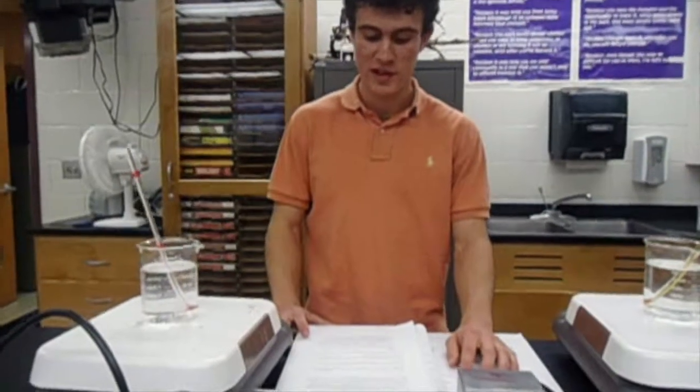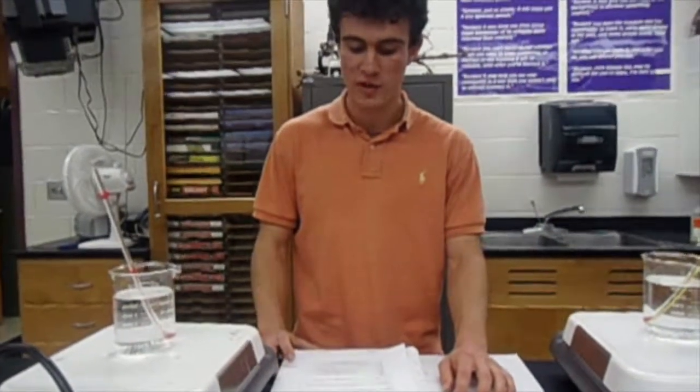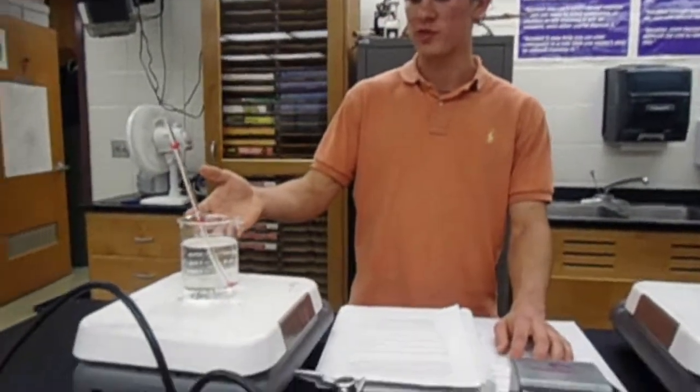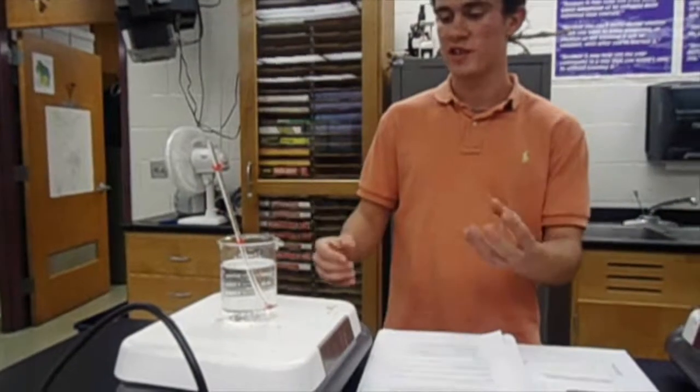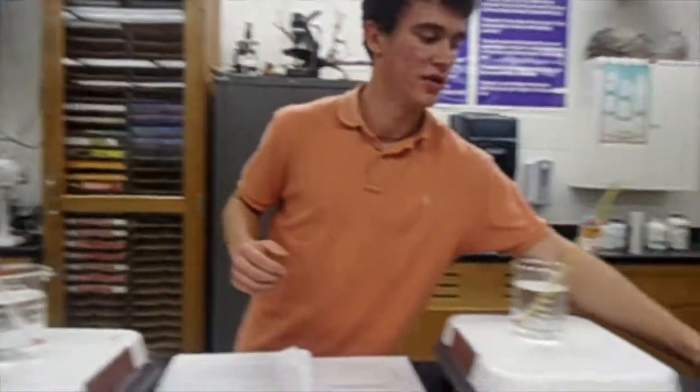Our hypothesis is if the temperature is increased, the amount of carbon dioxide in the fermentation tube will be greater because cellular respiration is more efficient in a hotter climate. So our prediction is that this one will produce the most carbon dioxide. What that means is that the enzymes in the fermentation tube, which is a yeast and sugar mixture, will produce more carbon dioxide because they are reacting more efficiently. The opposite pole, in the refrigerator over there, is going to be less. Enzymes will react slower, not as efficiently, and therefore the carbon dioxide buildup will be a lot less.